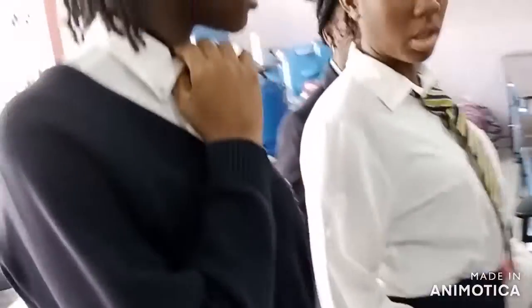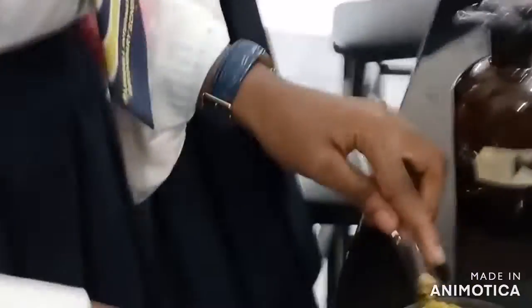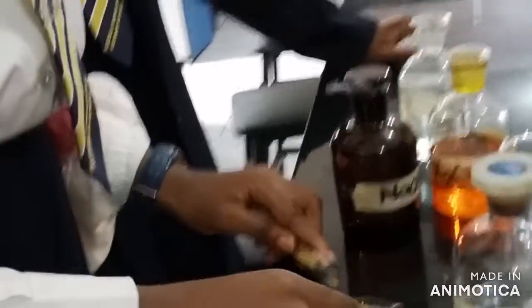You already have your sample C. Please raise sample C up so we can all see — that's sample C in the petri dish. Now the first instruction says to add 10 cm³ of distilled water. Put all of sample C in your test tube and add 10 cm³ of distilled water. When you add water to a salt sample, you are basically testing for the solubility of the salt.